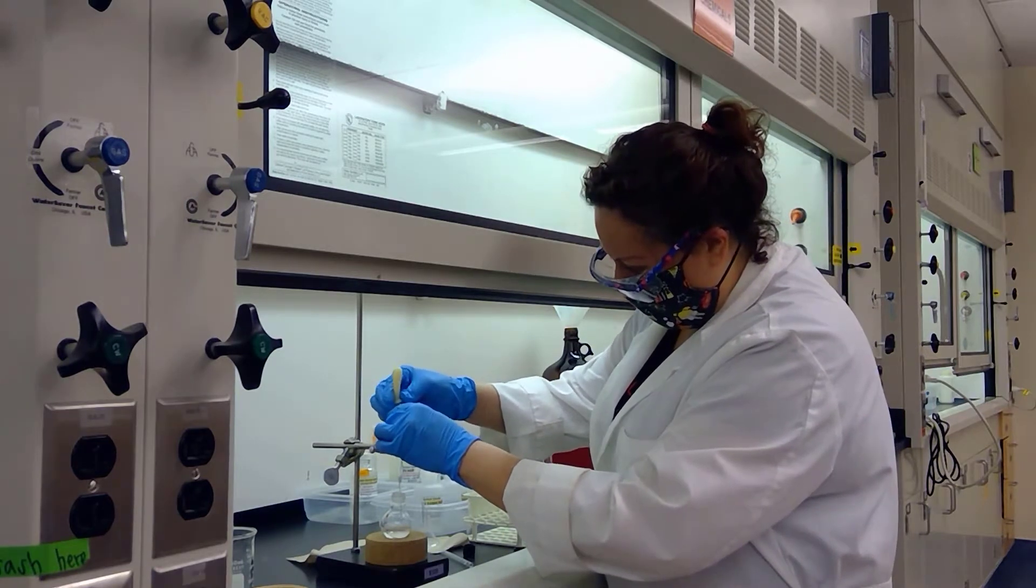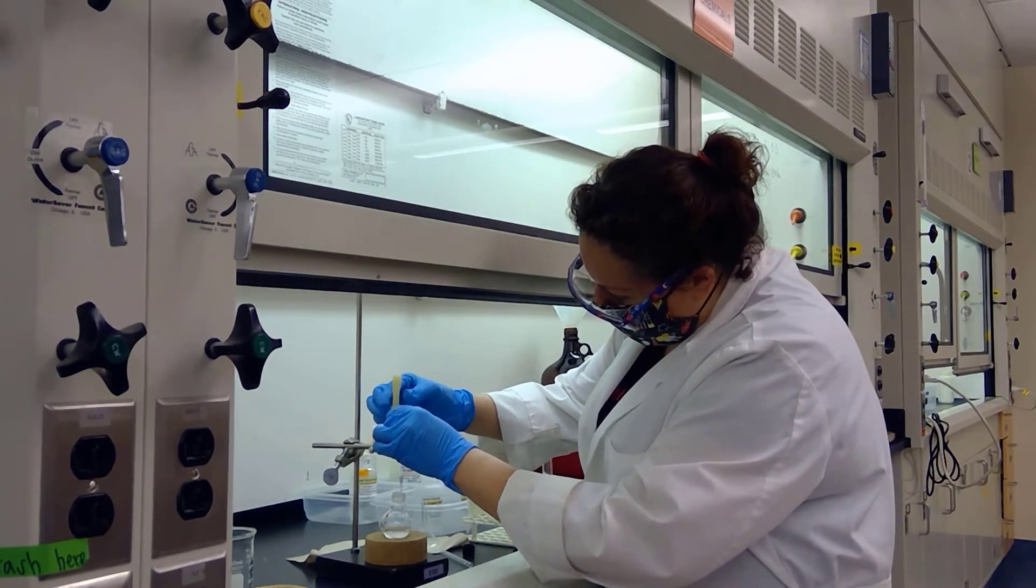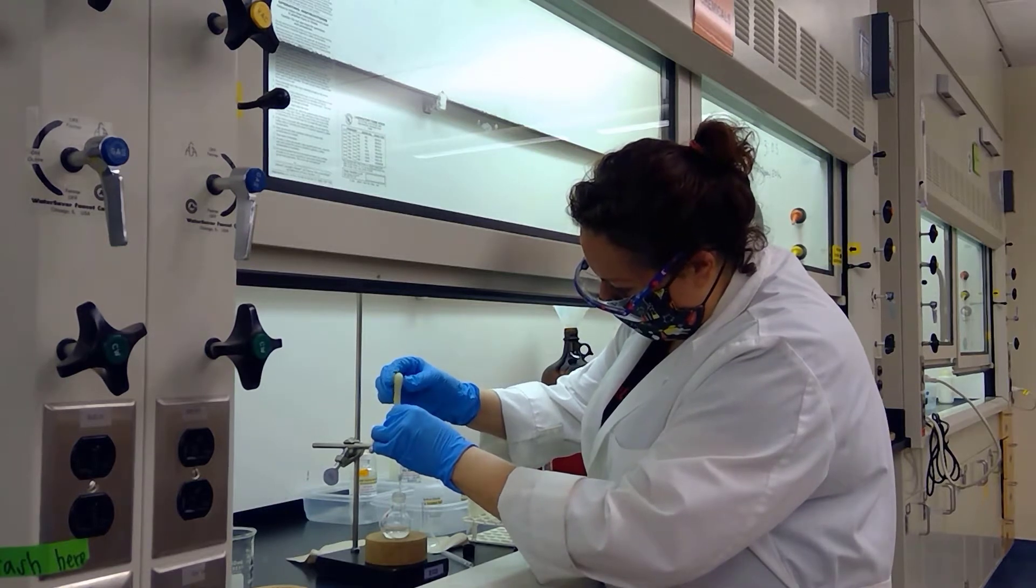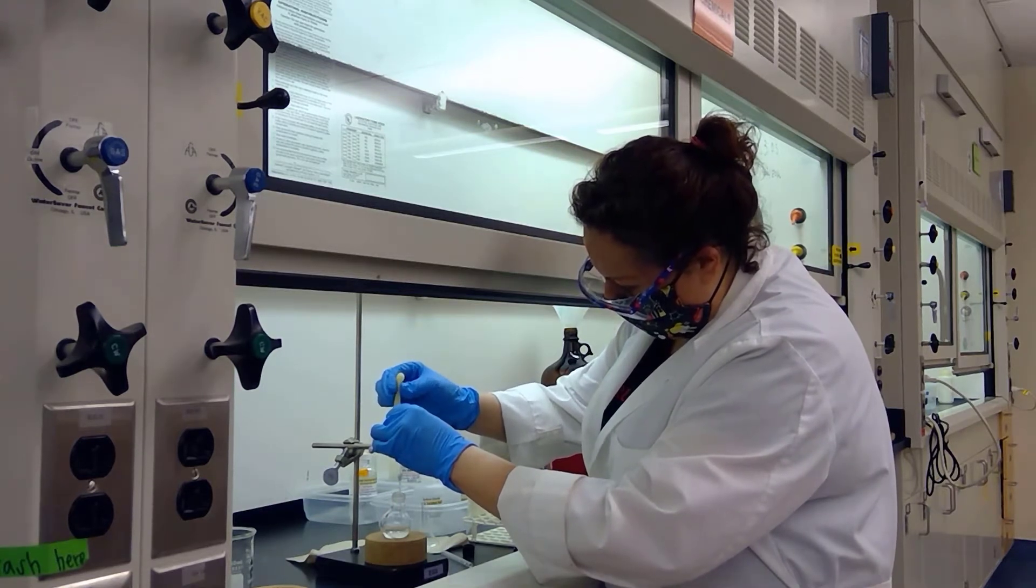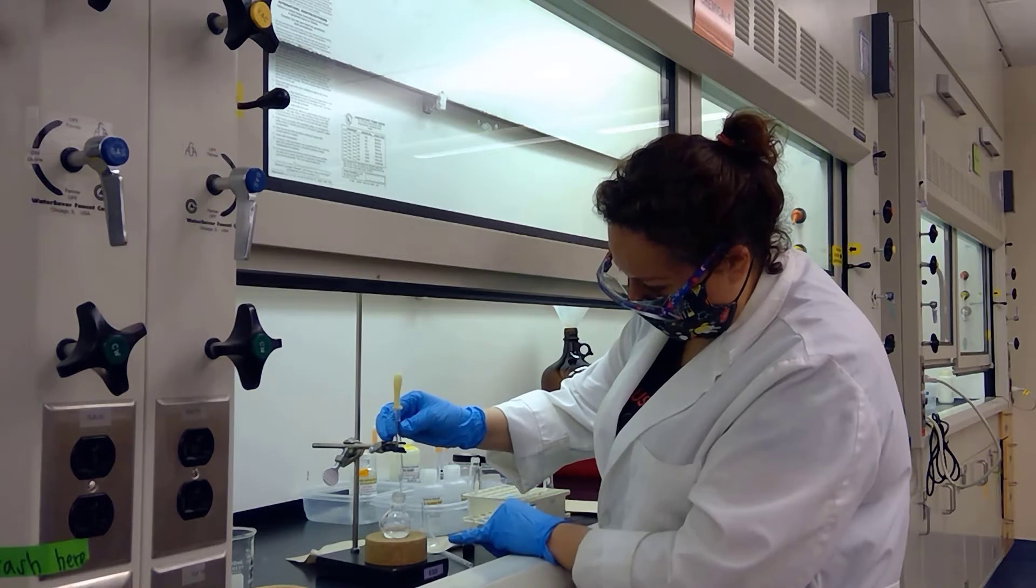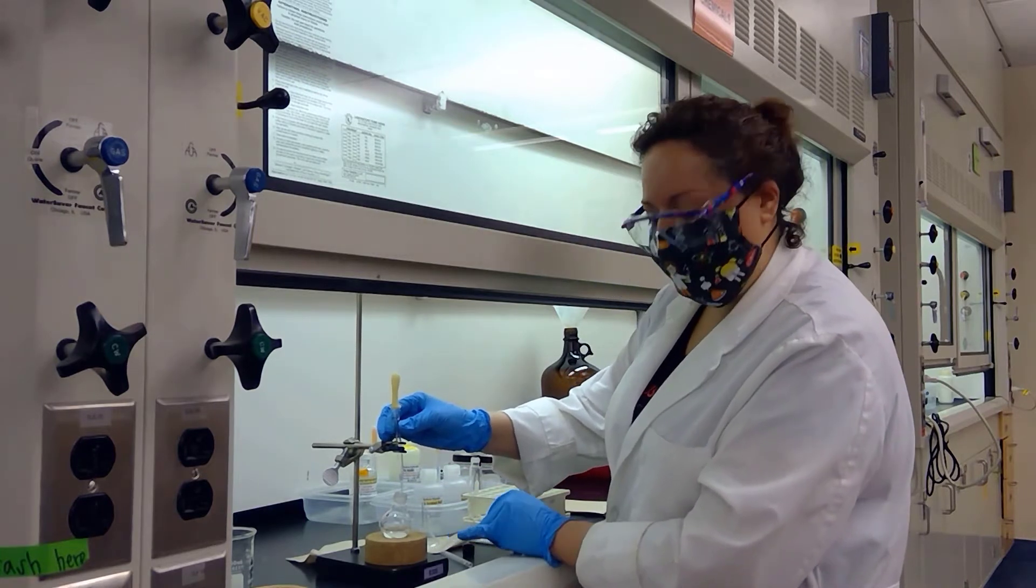I go ahead and attach my little bulb here and squeeze down so that the air can force the rest of whatever liquid is available through.